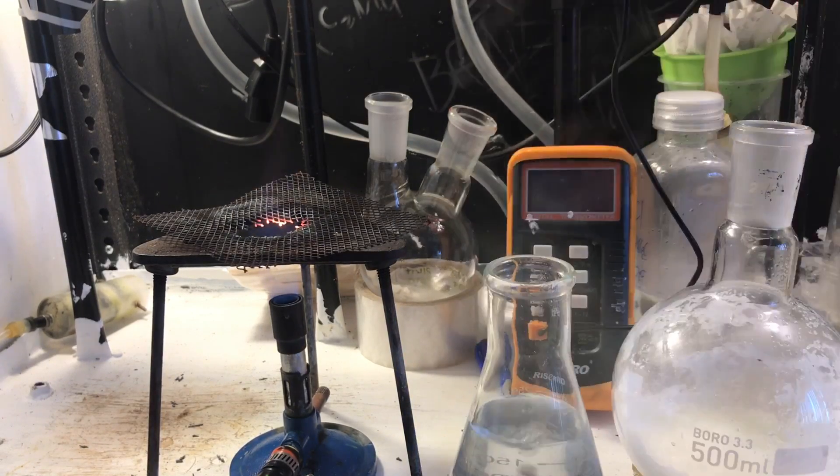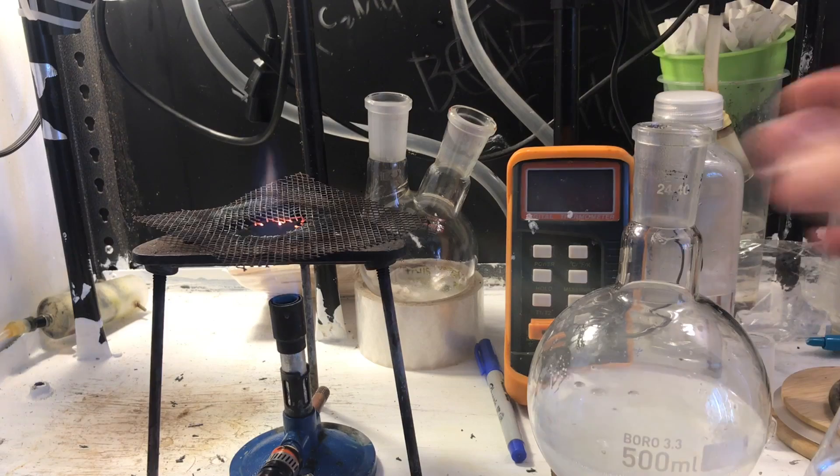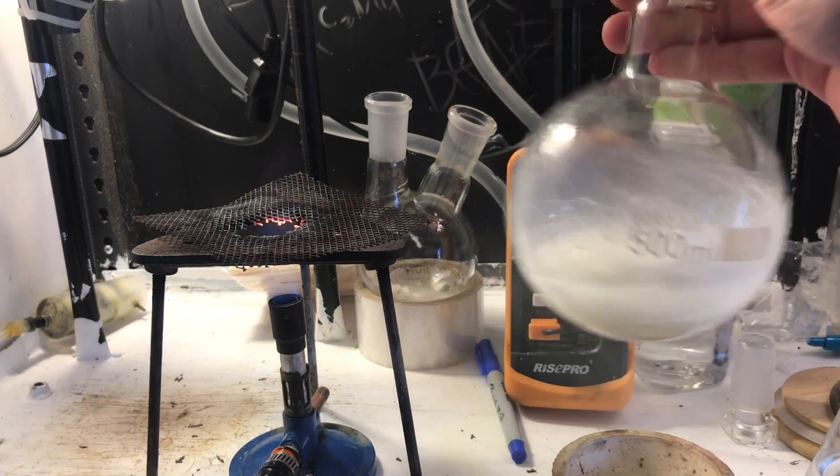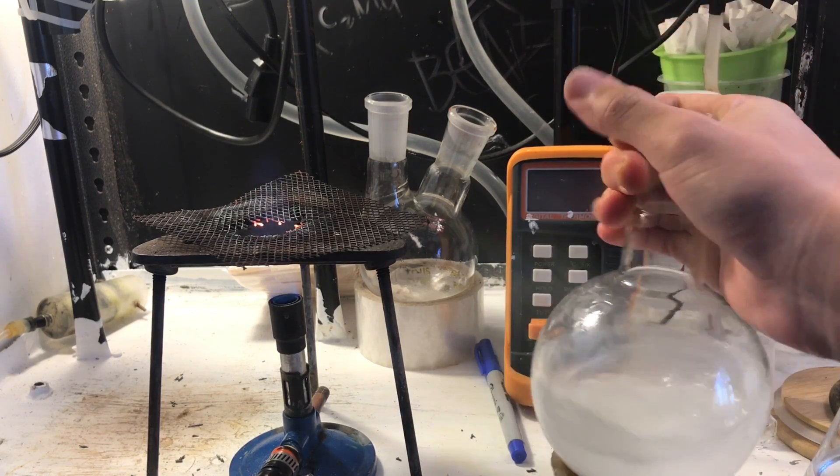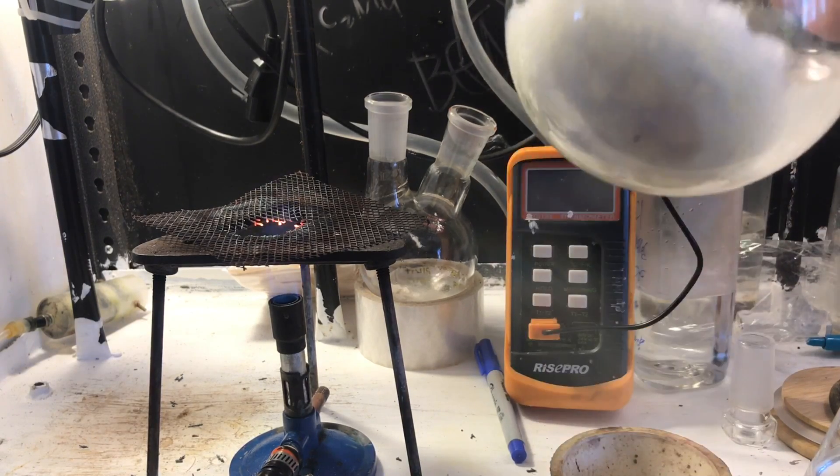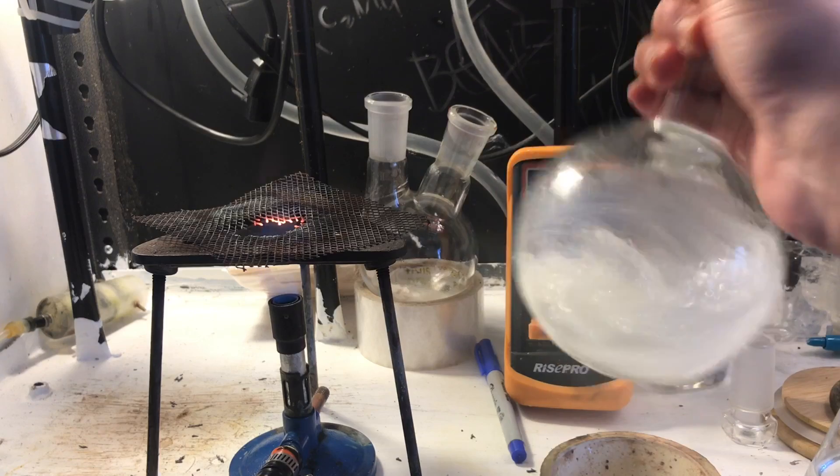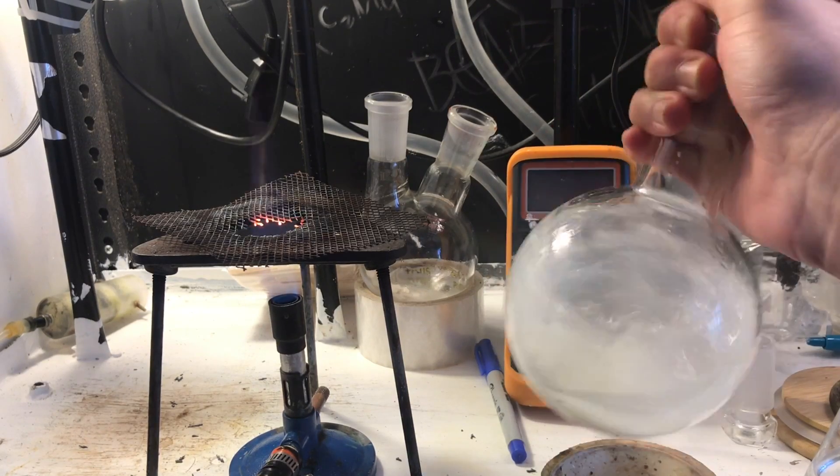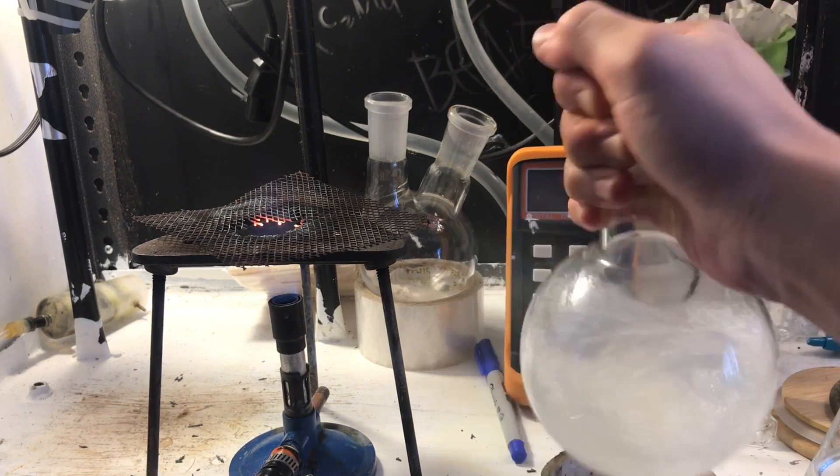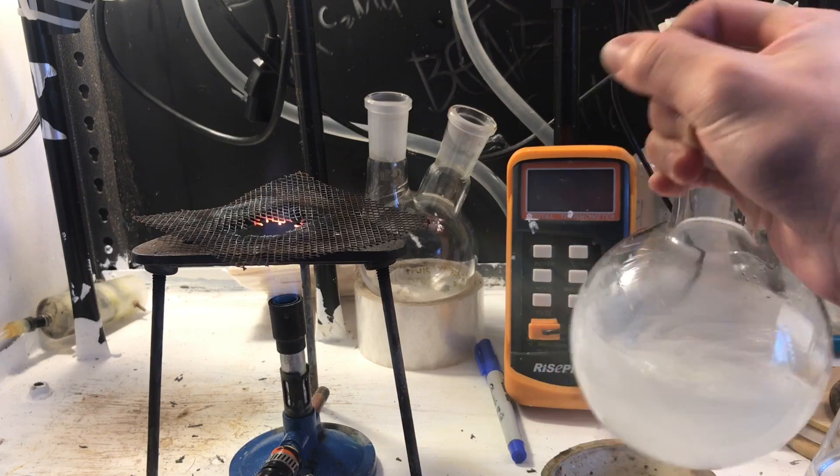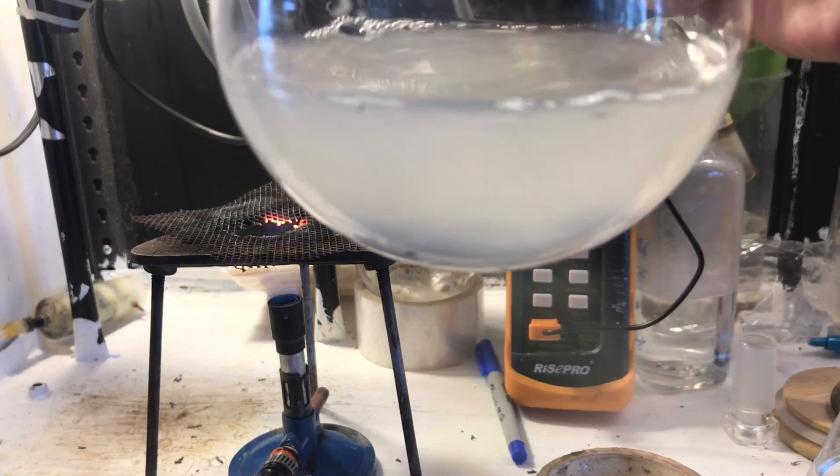Now, to your cake in the HCl generating flask, add in some hot water, and with some swirling, the cake will free itself from the glass and dissolve. This is mostly sodium bisulfate, but may also contain traces of sodium sulfate and leftover sulfuric acid, and maybe some leftover NaCl, although I doubt that. Just swirl it for a good few minutes. Don't shake it though, because if the cake does loosen up, you're gonna smash the flask. I've done that multiple times with leftover stuff in a nitric acid distilling flask. Don't shake it, just swirl it carefully.